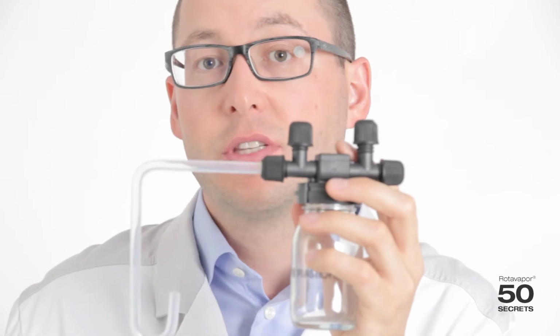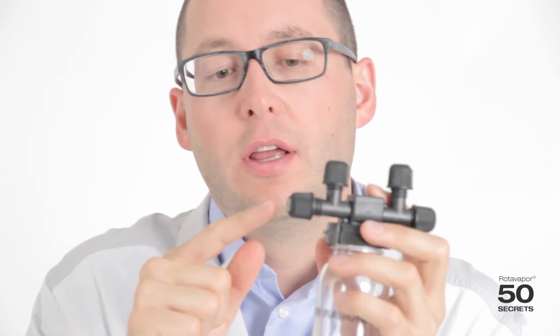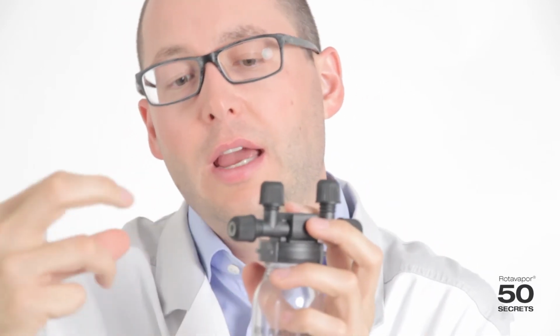That's it. That's how simple it is. So, as I said before, the most important thing here is that we actually first do the sealing into that and then put it on, and only then we push in the hose.